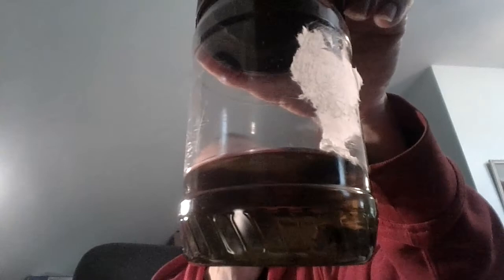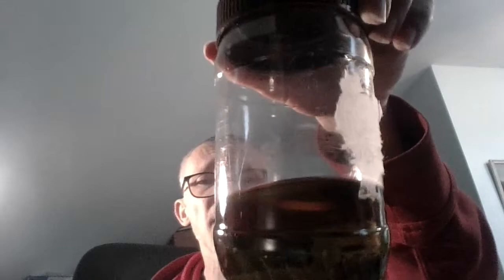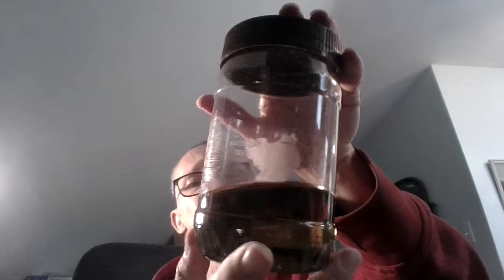This has a silverfish in it. The idea is you want to preserve it — the alcohol is going to do that. Again, you want to keep this stuff out of sunlight. One thing about alcohol: if you have an item that is dark in color, it's going to suck the color out of it. This happens to be a caterpillar — a hornworm I picked off one of our tomatoes — and you can see this used to be green. The alcohol has done exactly what I said and sucked the color out.